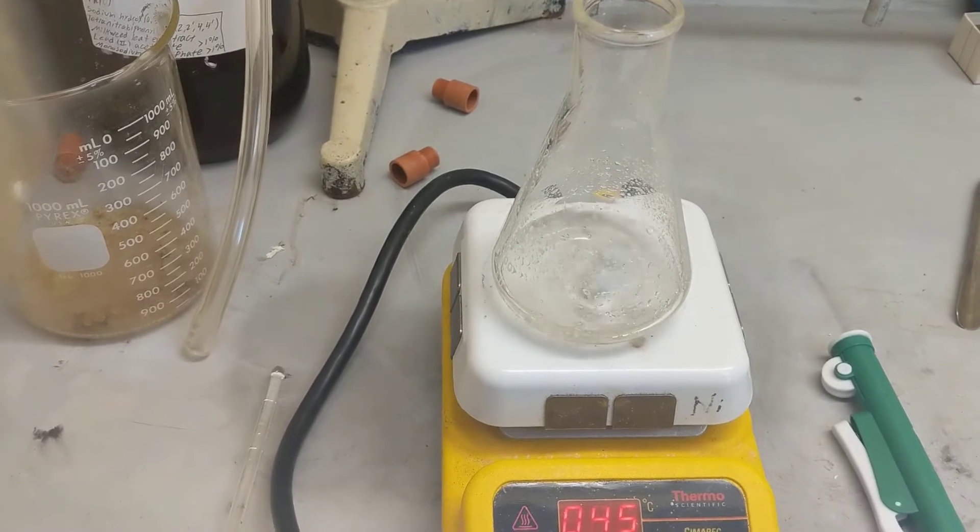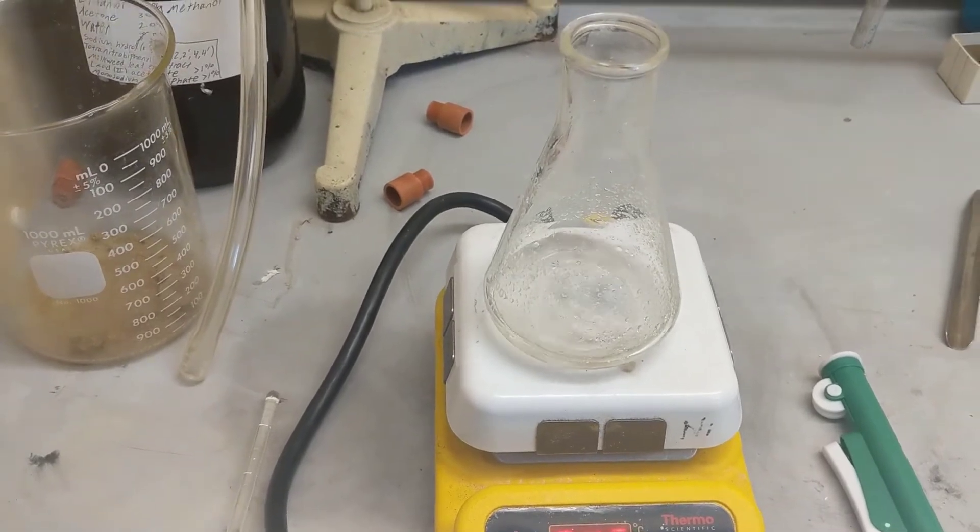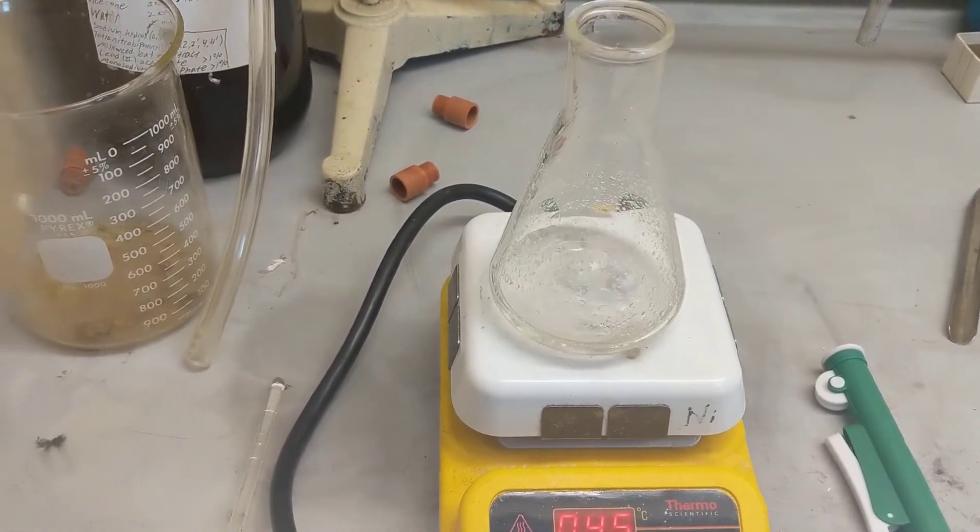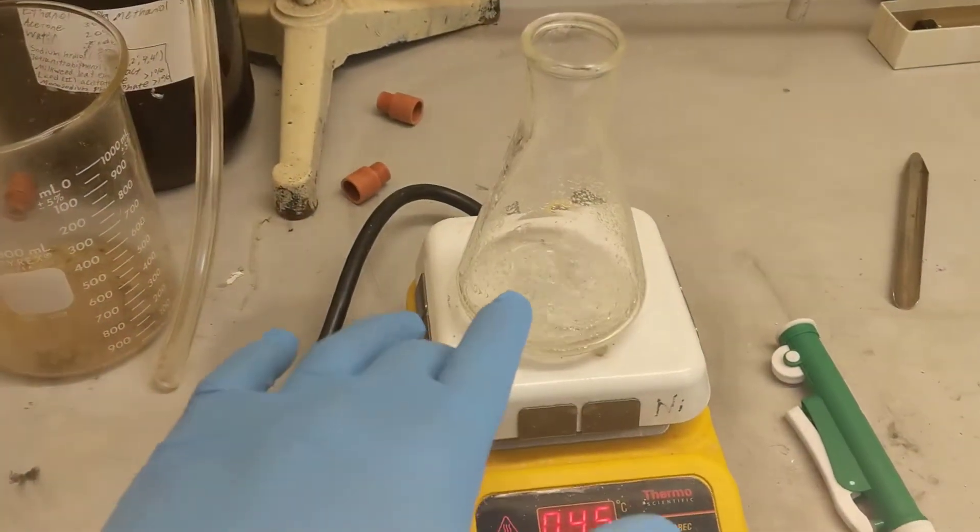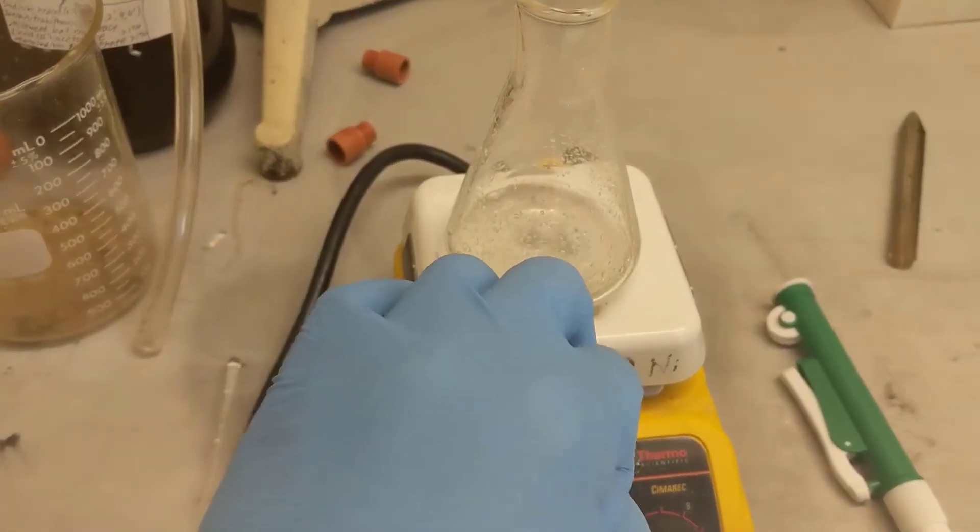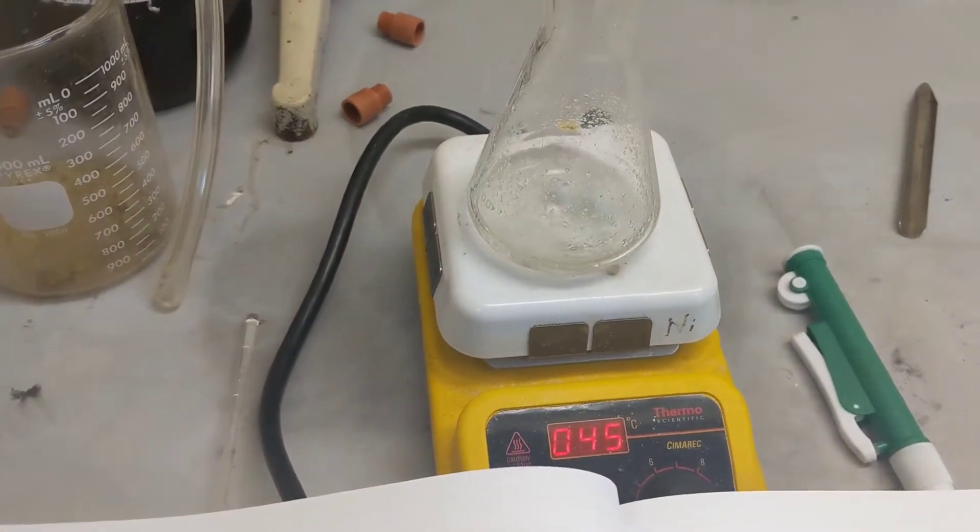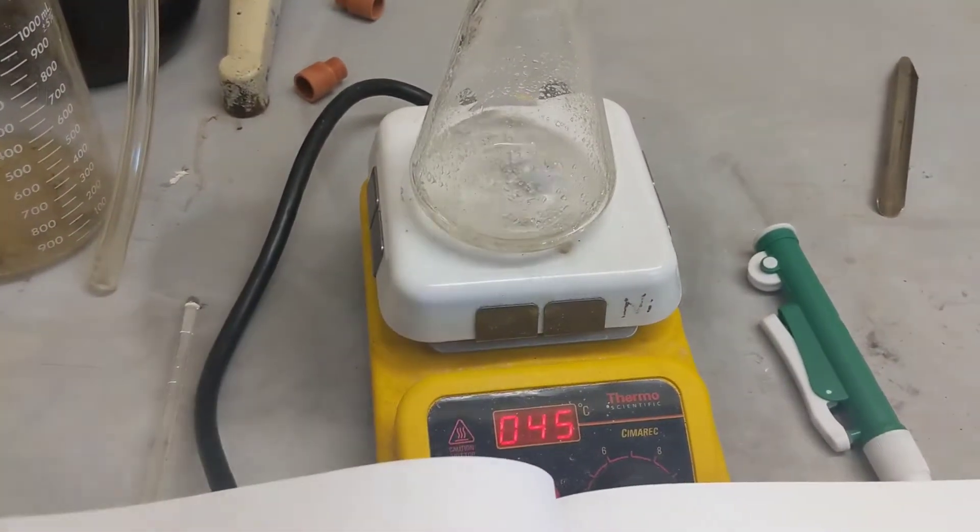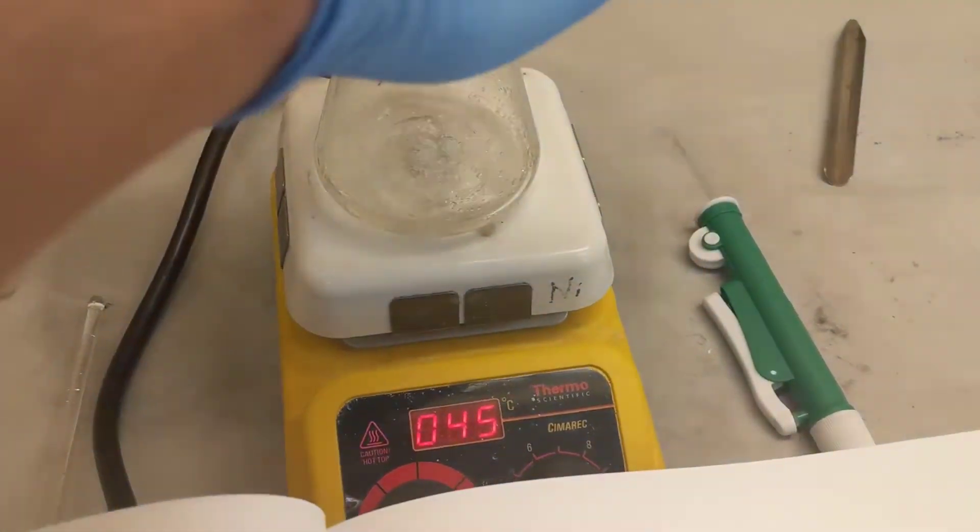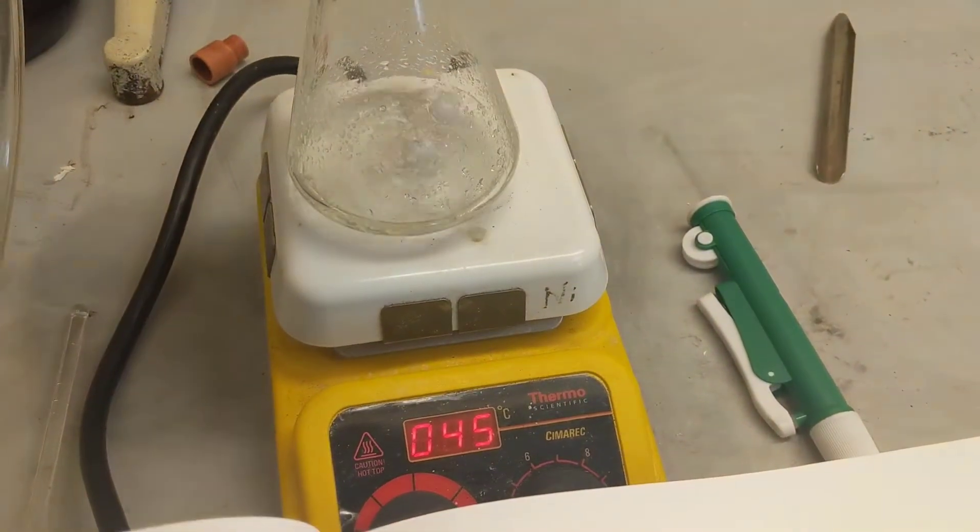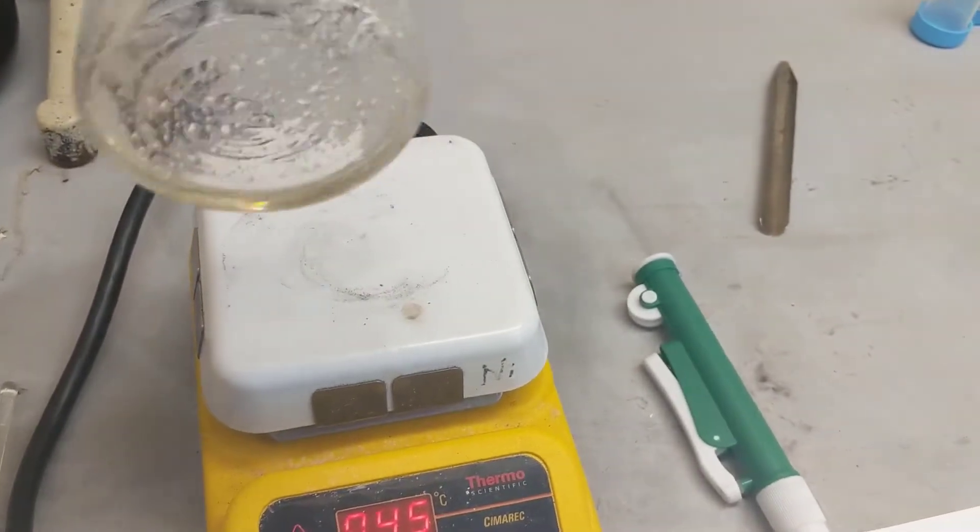The protic solvent is used in this reaction. This is my ammonium chloride, ammonium bromide, sulfuric acid, and water mixture. It's referred to as nucleophilic solvent in the lab. I just spent the last hour and a half mixing it. It's protic, which means that it has a lot of protons dissolved in there along with our substrate.